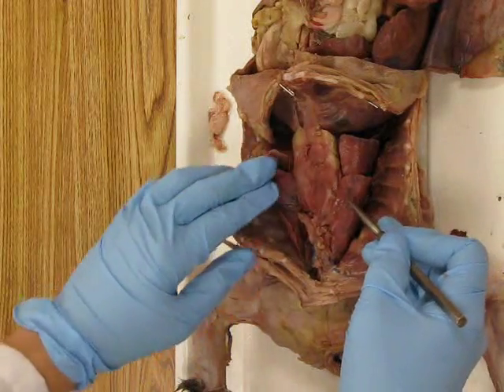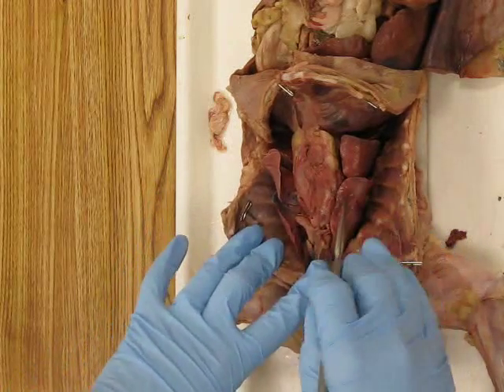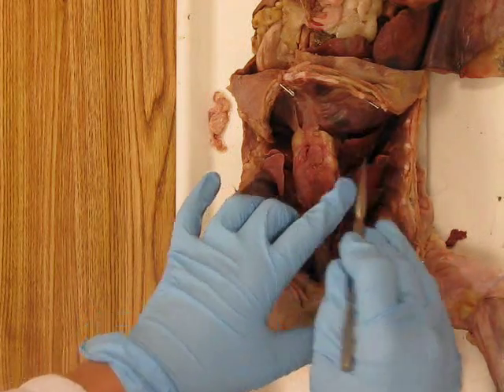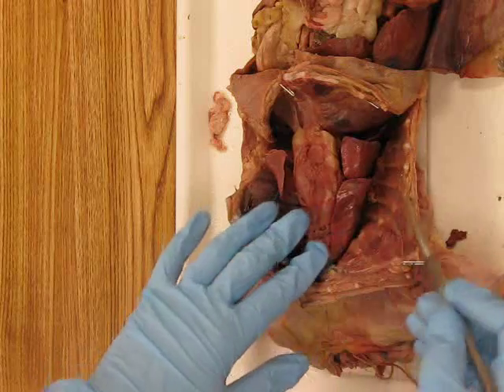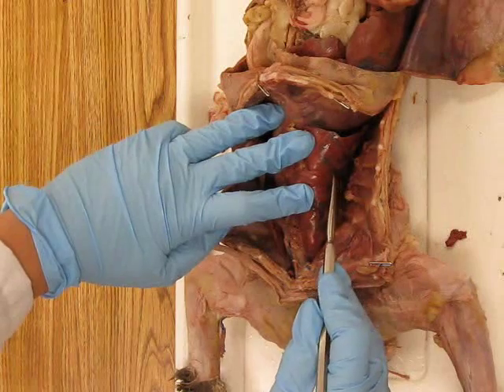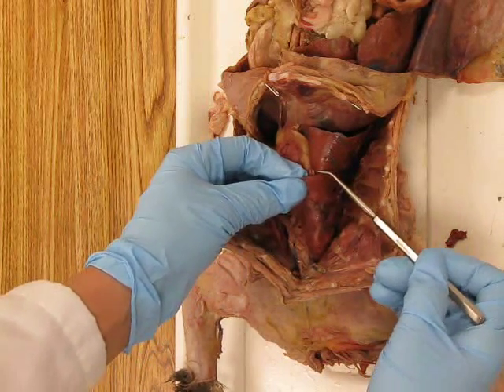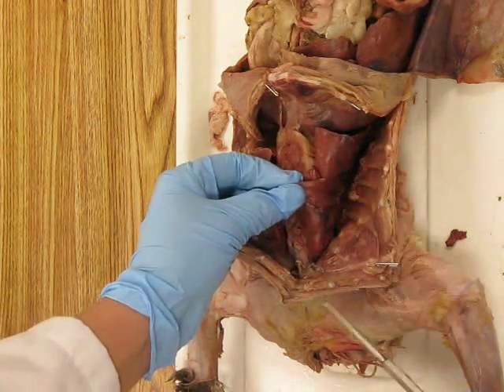And each lung has a different number of lobes. The right lung has more lobes than the left lung. The right lung has a superior lobe, a middle lobe, and an inferior lobe. And each lobe is separated by narrow slit-like openings called fissures. And the fissures are named for their orientation. So this fissure goes directly across, and we know that we call that transverse normally, which is in a horizontal position. And so this fissure is called the horizontal fissure between the superior and the middle lobe.